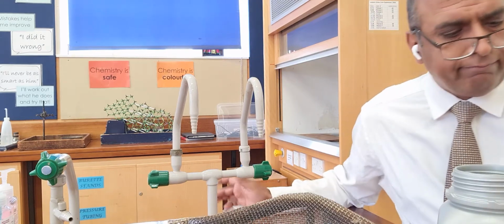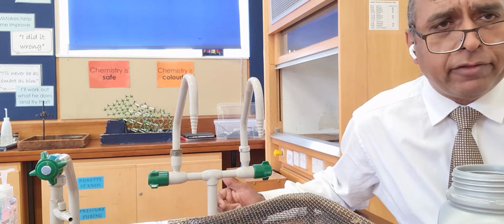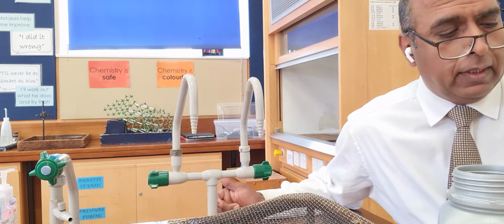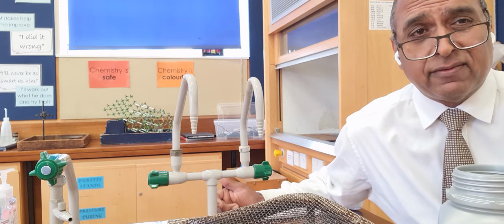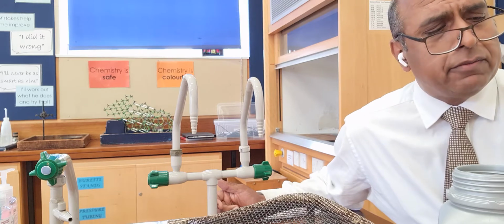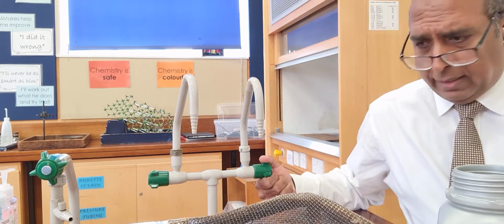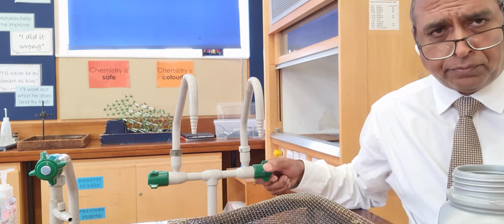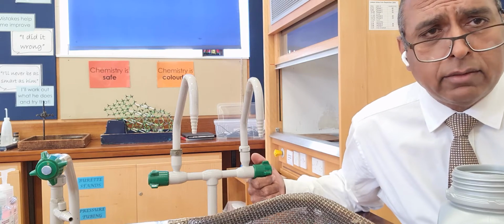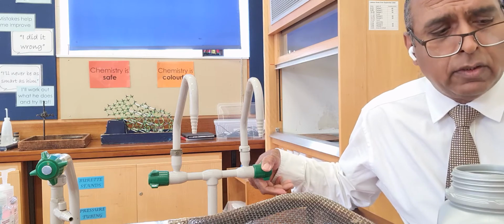Solubility. So solubility relates to having a solvent, normally water, into which we dissolve things. And those dissolved things are called solute. Now to show you a very common experience of this, I can take some water and dissolve sugar in it and get sugary water. The sugar is the solute and the water is the solvent.